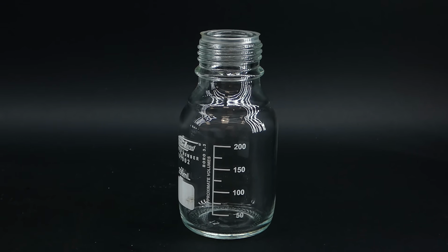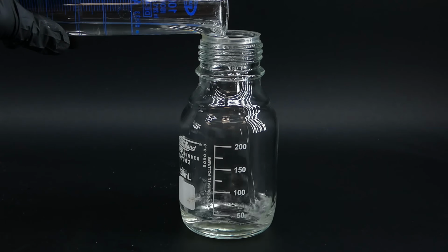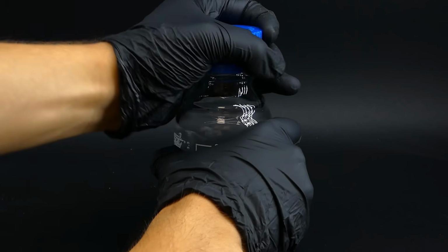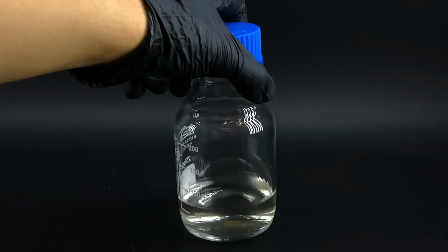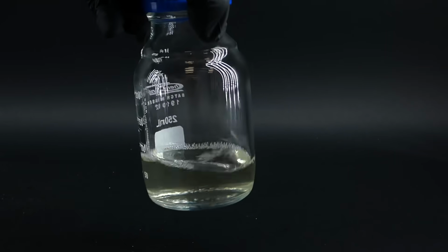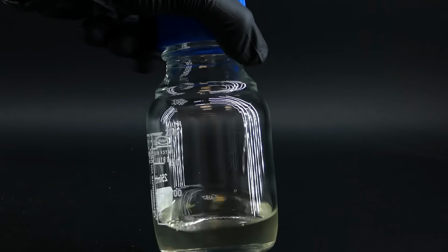To store it, I poured it into a glass bottle and tightly sealed the lid. Acetic acid is not nearly as angry as, for example, nitric acid, so I did not need to take too many safety precautions to store it for a long time. And now that I finally have it, I can test out some of its properties.